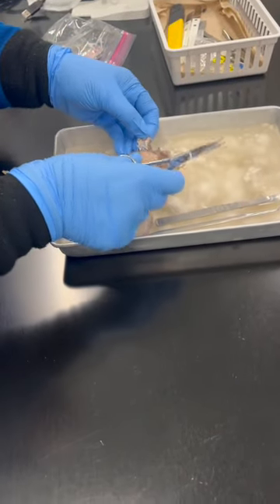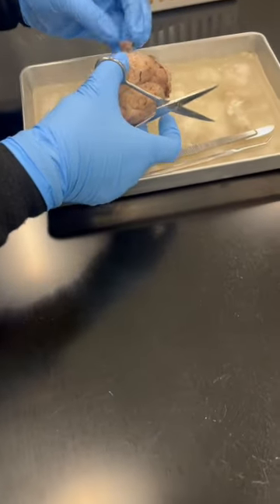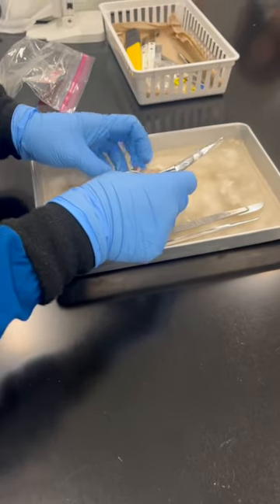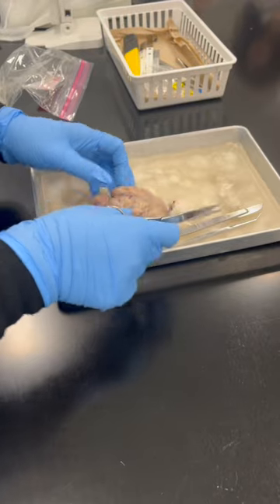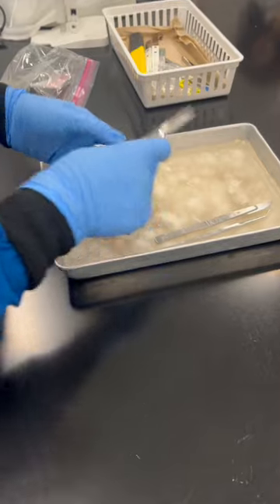See, this one is very tough. This portion is a thick structure. Now you take off all of that, what is that? Dura mater. Now you can see this structure a little bit better.